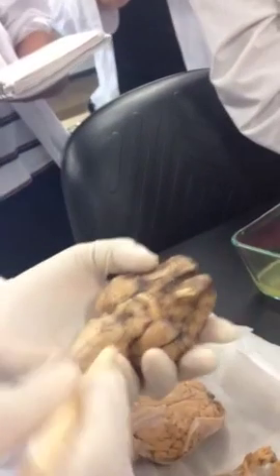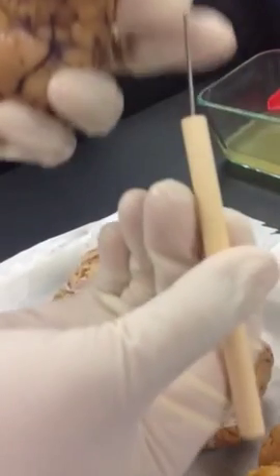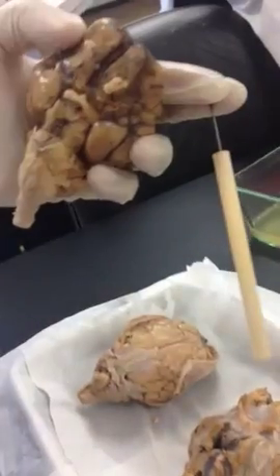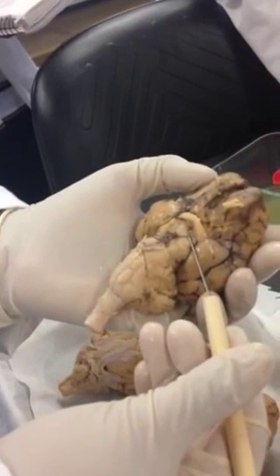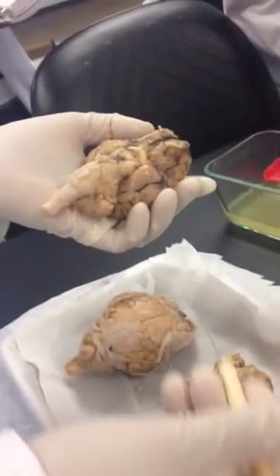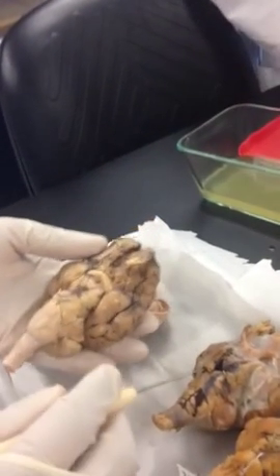Okay, so in your book you will see a word called infundibulum referring to this whole thing, but that's the continuation of the stalk of the pituitary gland. It's like a straw. Imagine a straw. So that's your infundibulum, but we will point to this hole as infundibulum because if your pituitary gland breaks off, you won't see that. Okay, so you see the difference, right? That's an important thing to make a note.